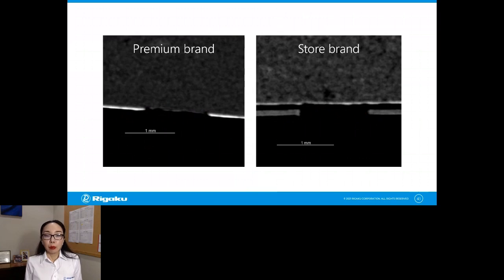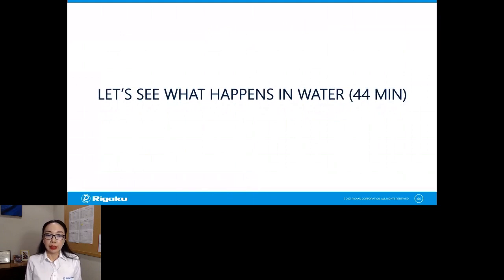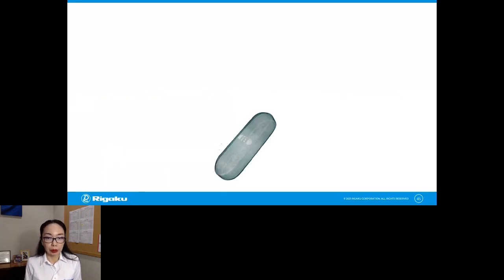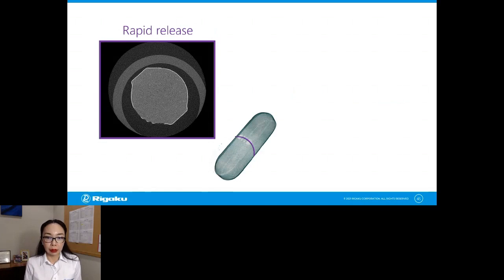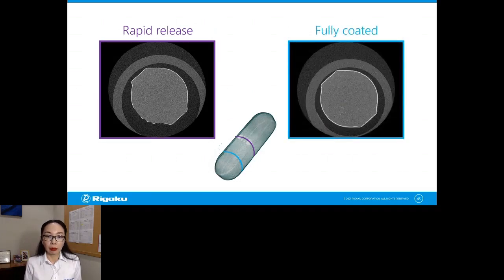Now, I got more curious after looking at those scans and wondered, can we see what happens in the water when you put this tablet in the water? So I did a time-resolved experiment for 44 minutes using this premium brand tablet. We did the scan for the entire tablet, but we're just going to monitor this rapid release cross-section and another part, a fully coated part cross-section. And you're looking at the dry state right now. This is a plastic container, and we're going to put water in this space.